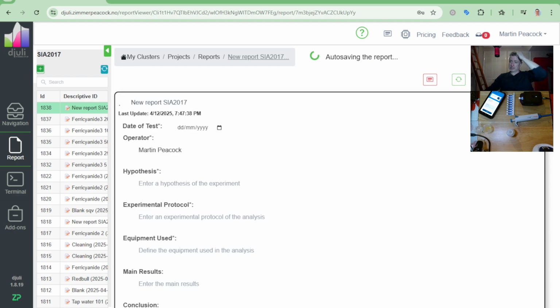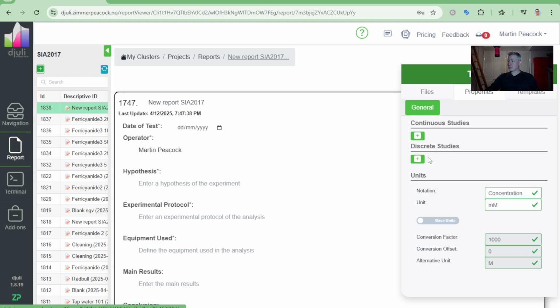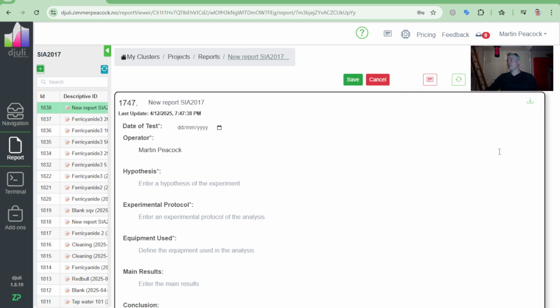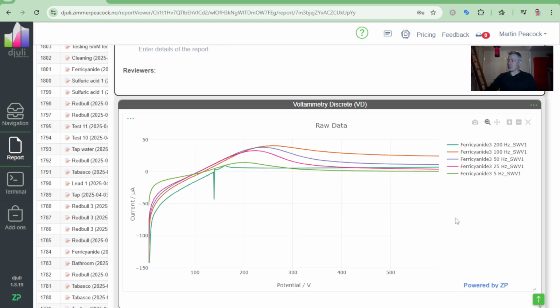And once that's done, I'll just turn this off for a second so we can see what I'm up to. I just want to show that data now, so I can go here, tools, I can see all my data's there, properties, this is discrete, so it's going to extract it, and we'll have a quick look at that. Yeah, so that's quite interesting. Yeah, see, so it's really interesting actually.